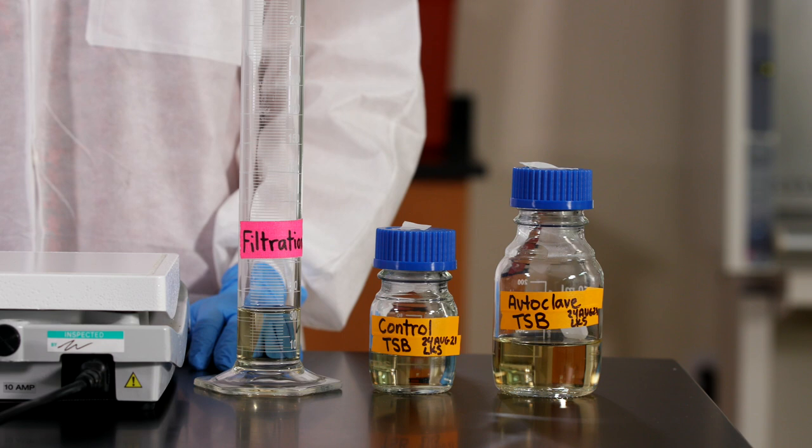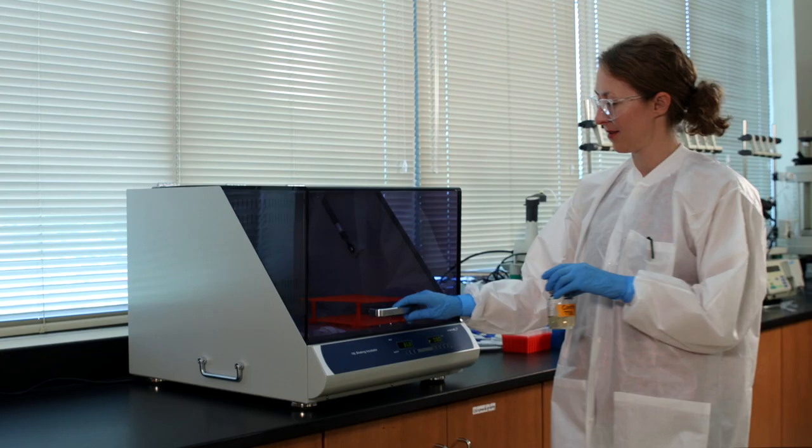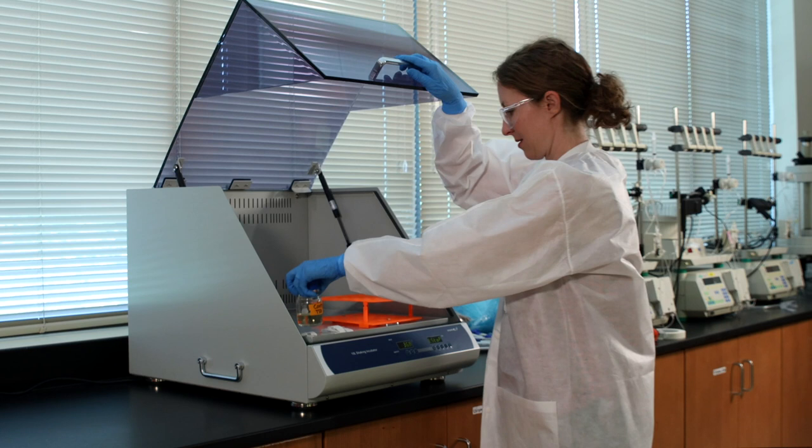We'll leave the last 40 ml of broth in the graduated cylinder for filtration. We're not going to do anything to treat the control, so let's go ahead and place it in the incubator.